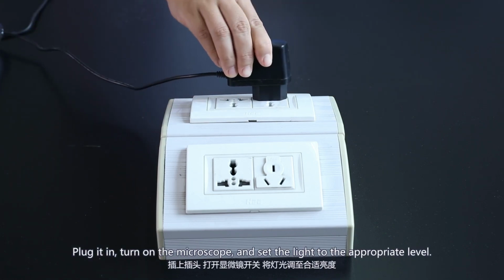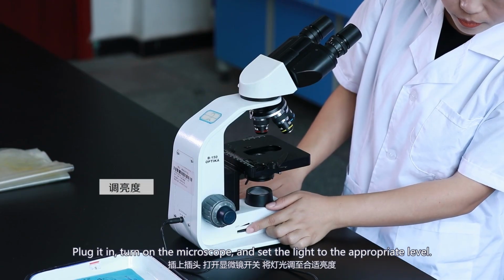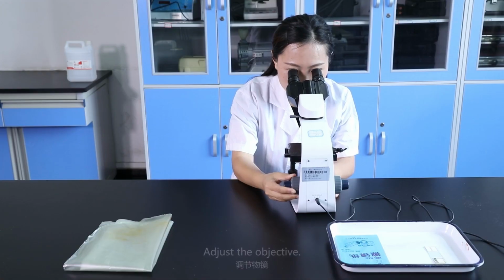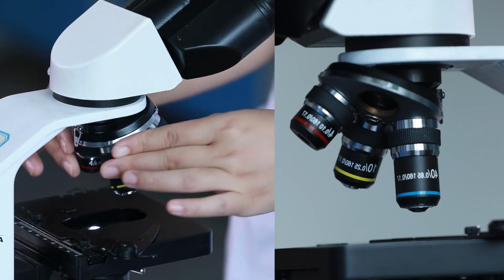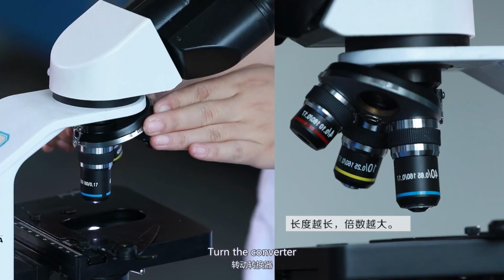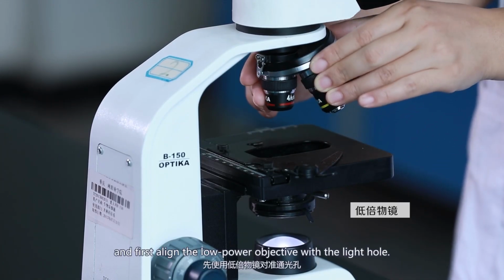Plug it in, turn on the microscope, and set the light to the appropriate level. Adjust the objective. The length of the objective lens is proportional to the magnification, and the longer the length, the greater the multiple. Turn the converter and first align the low-power objective with the light hole.